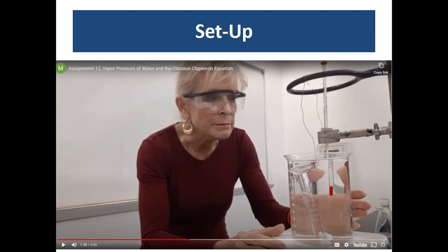Here we see our colleague Dr. Mary Perrault with the setup. You can see there the large beaker with the submerged graduate cylinder being held by copper wire from that ring support and there you can see the thermometer that is held by a clamp through a cork that has a slit in it so that you can read the markings inside the thermometer even if the temperature is somewhere inside where the cork is.